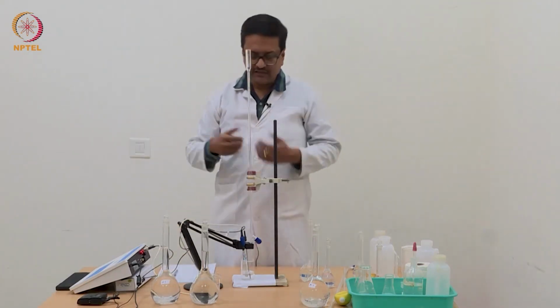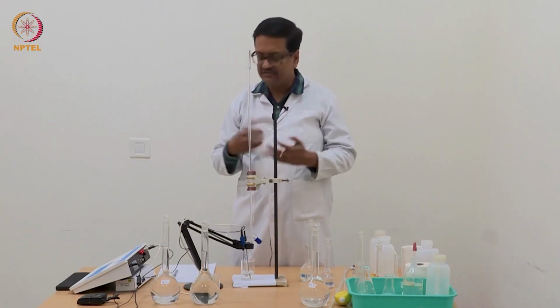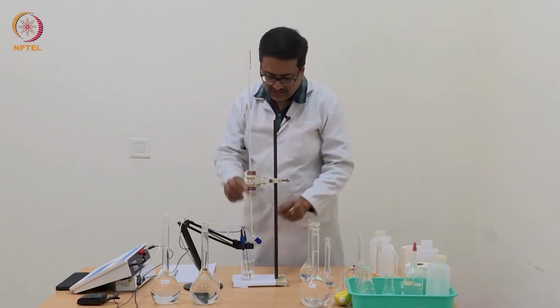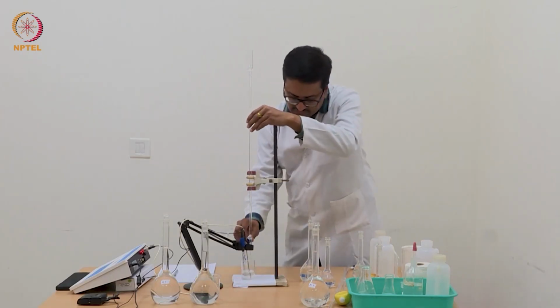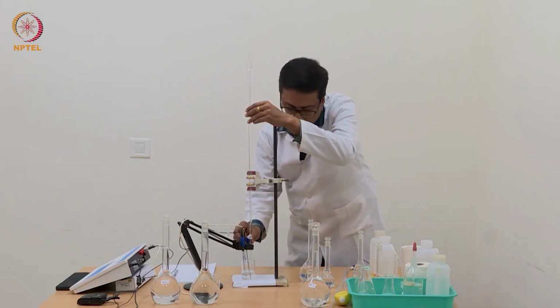So now I am guessing that with one more drop of NaOH, which will take us to 1.4 ml, we will have a jump in pH and the end point will be reached.